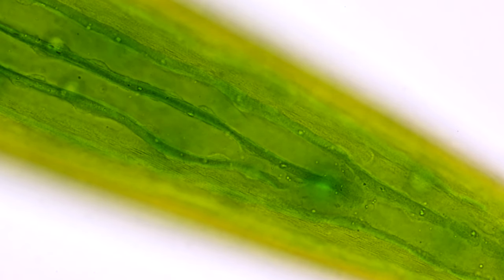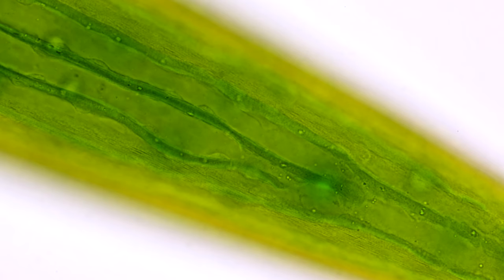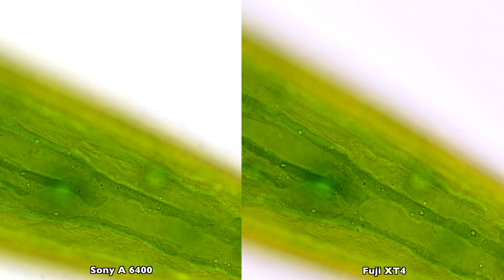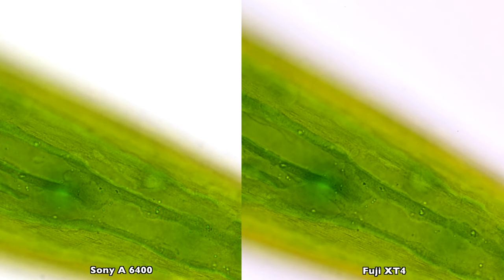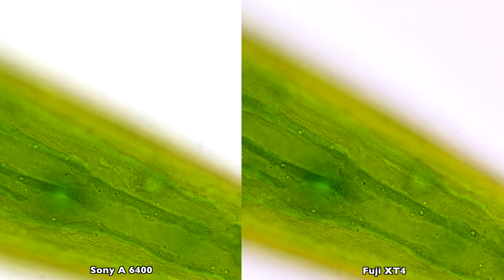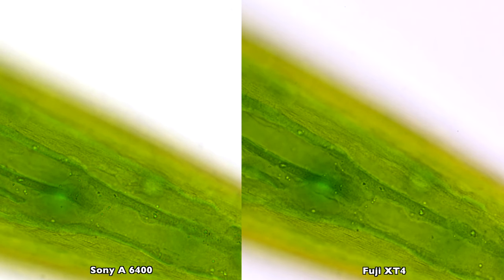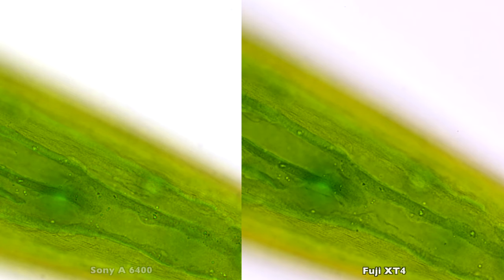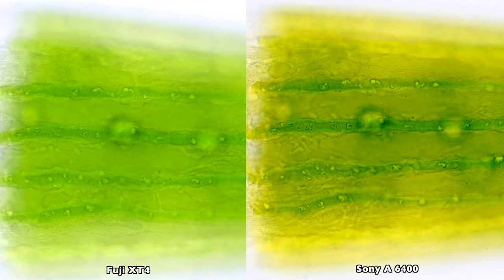But then I started to compare them directly beside each other and I was a little bit shocked. I don't know if it is just my impression or maybe you can even see it here on YouTube. But the level of detail that the Fuji camera produces is no match for the Sony camera. It's pretty scary.